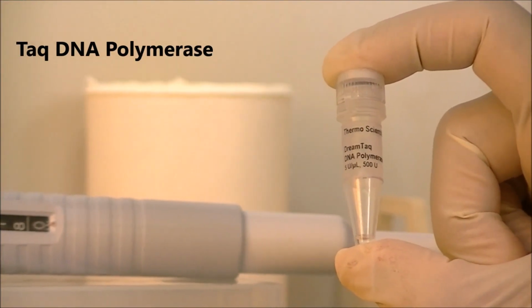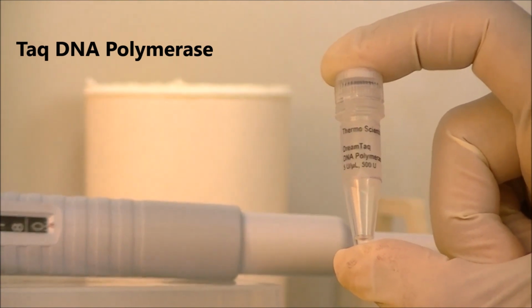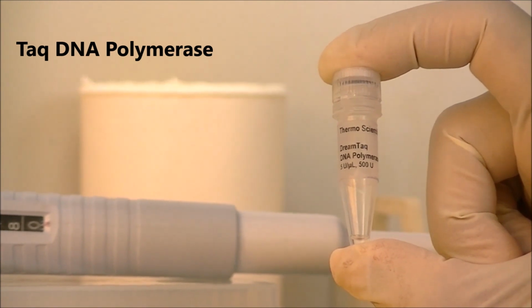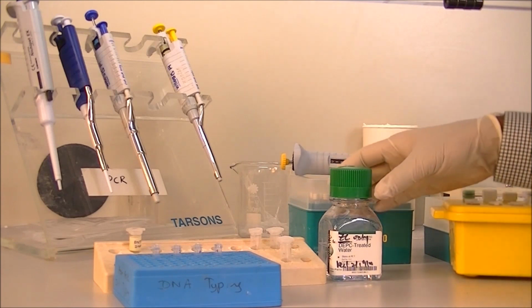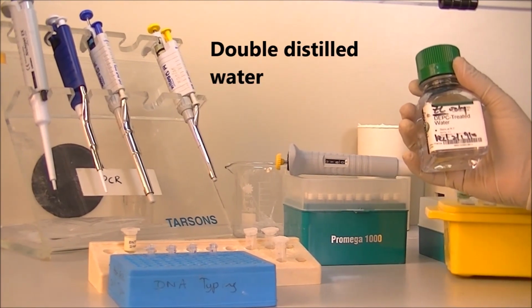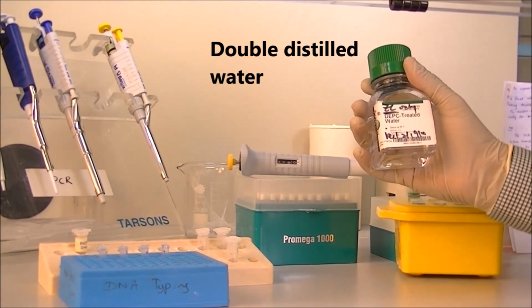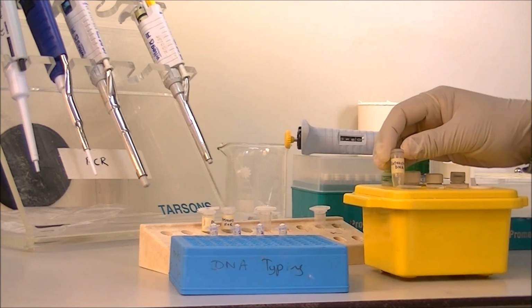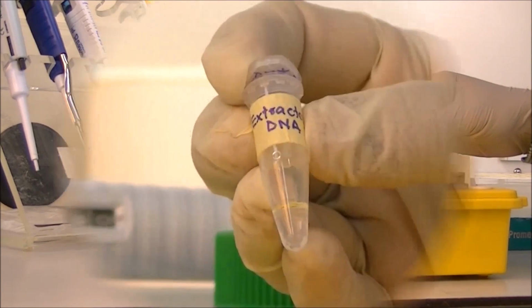Taq DNA polymerase is a heat-stable enzyme which has the capability of polymerizing nucleotides one by one sequentially when the reaction happens inside the tube. The final volume of the master mix is adjusted by adding double distilled water into the master mix. The final component that goes into the reaction is the extracted DNA.